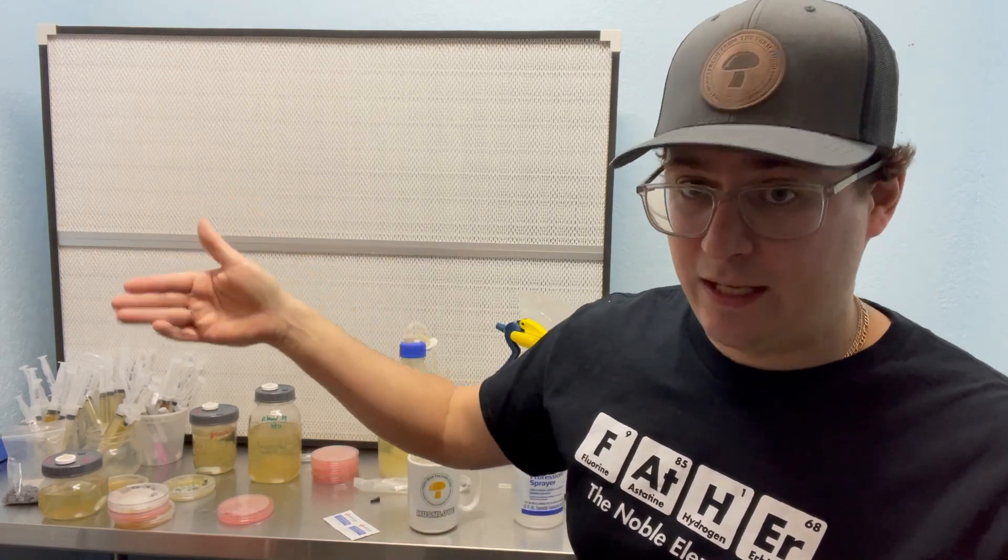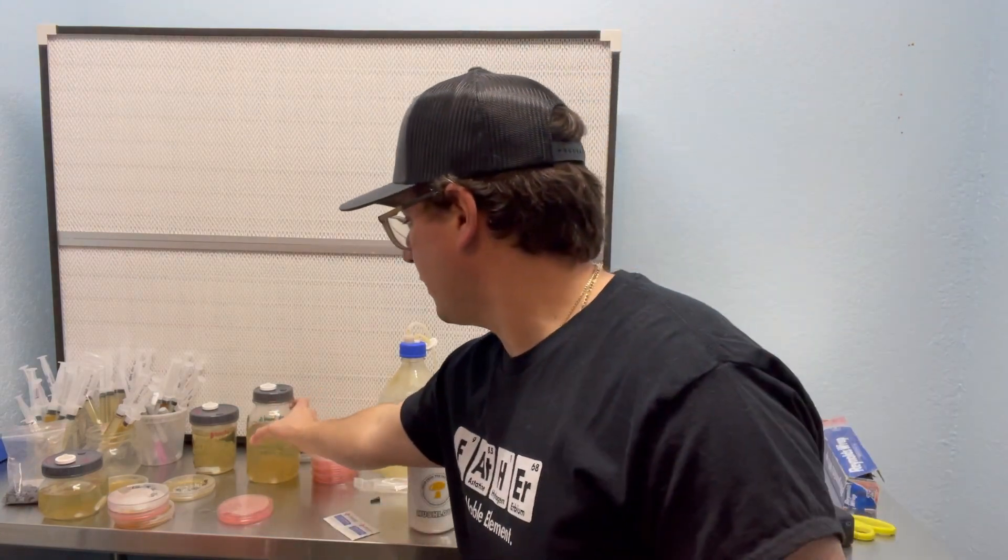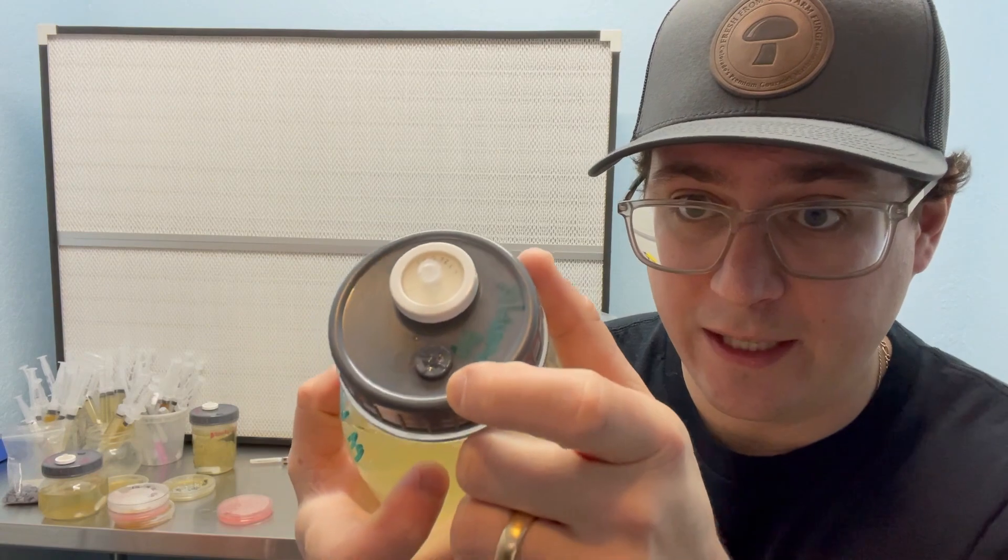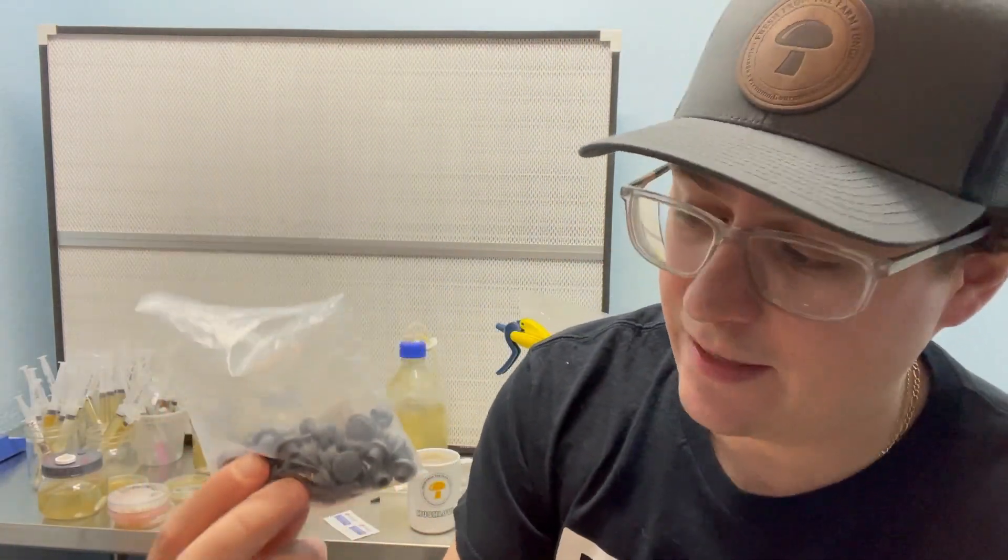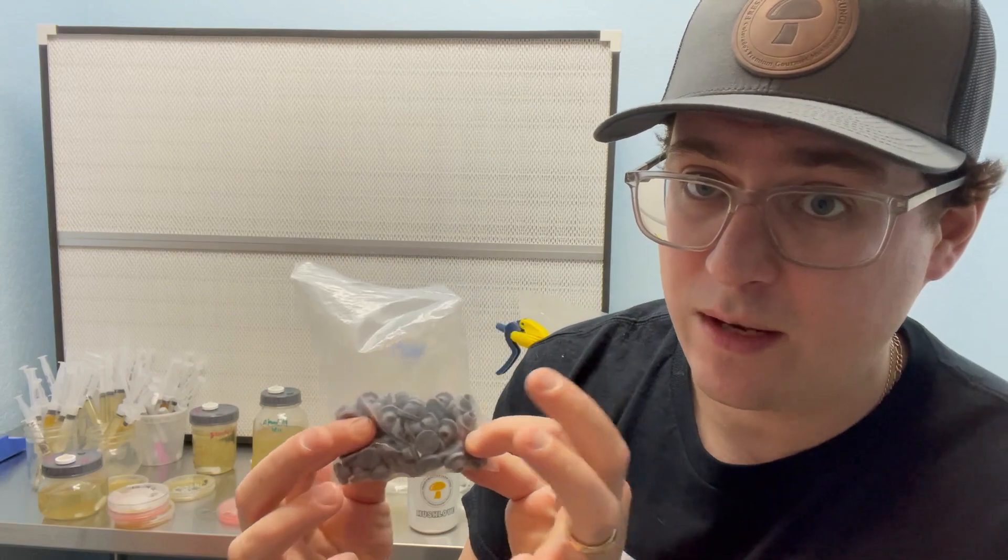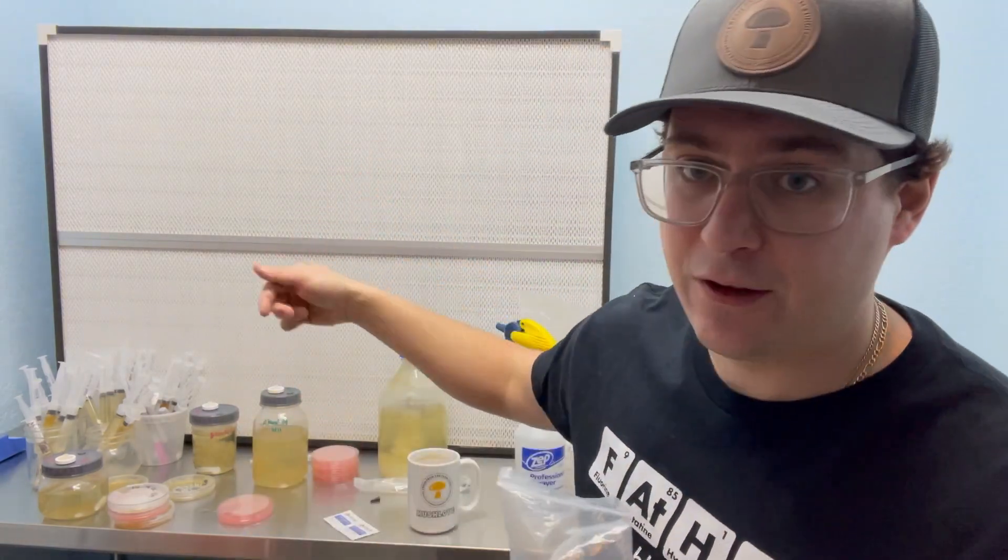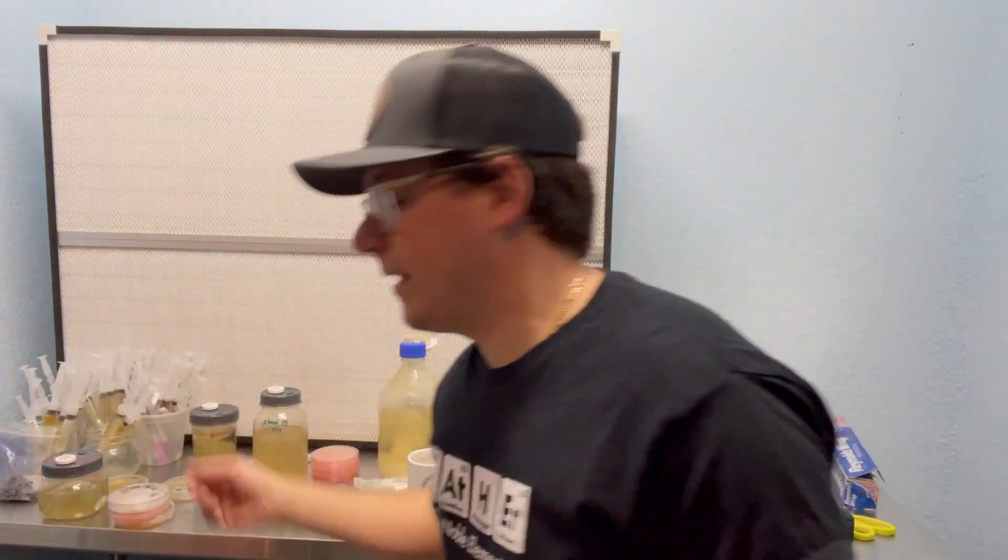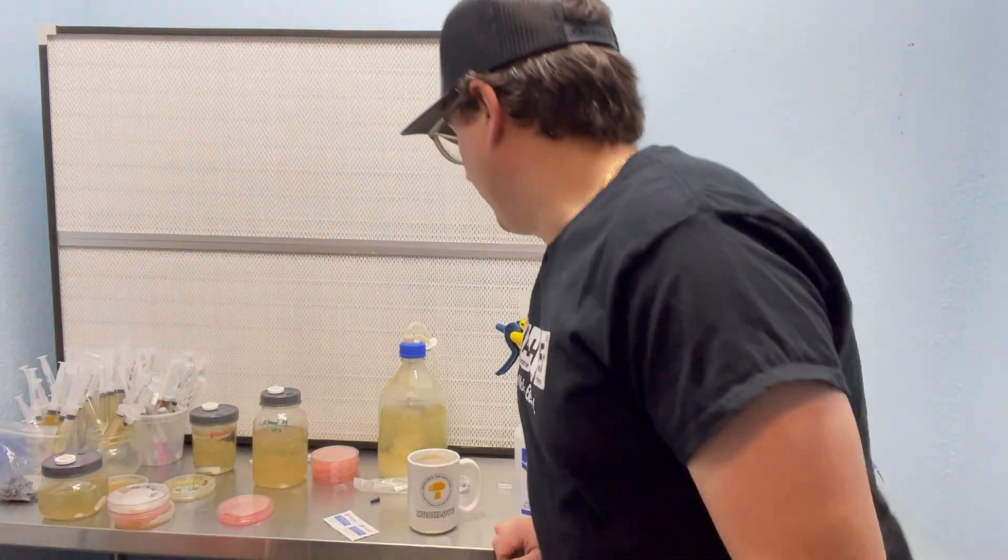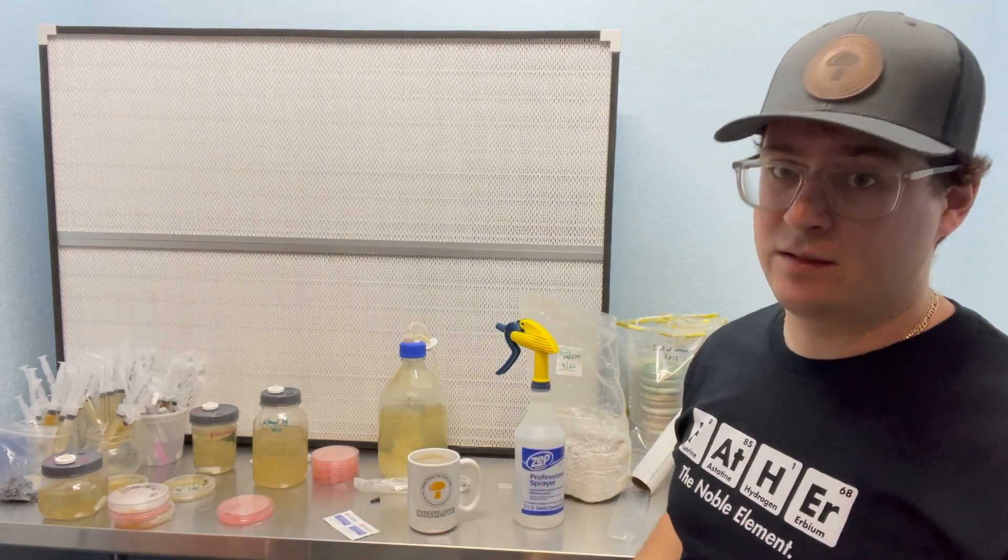Other problems that can occur. So if you got one of our mycology lids and you've used it 10 or 12 or 15 times, you might start to see some holes forming on that injection port. So I'll put a link for replacement injection ports here, but you're going to want to make sure that that injection port is always completely sealed because it's going to allow for air and potentially contamination to get in there. So that's another big problem that I see is people overuse the injection ports.